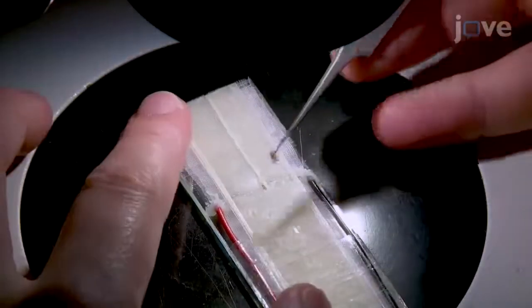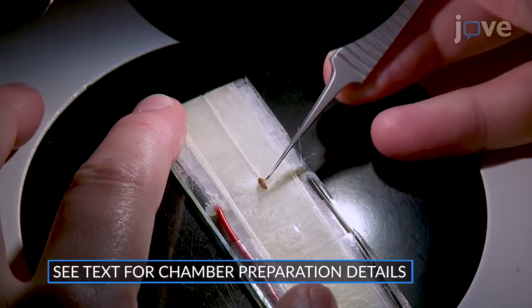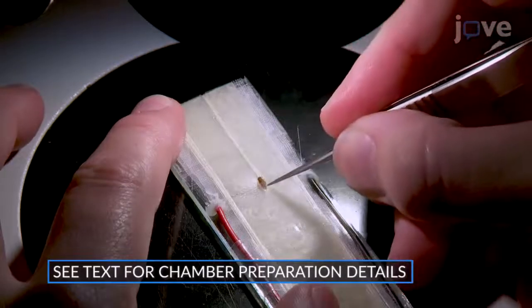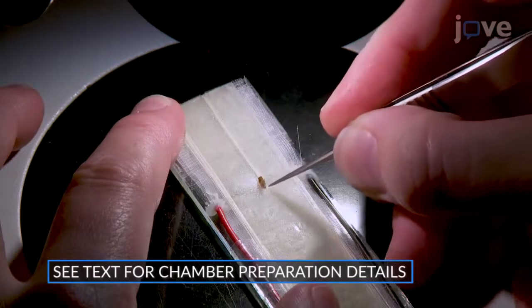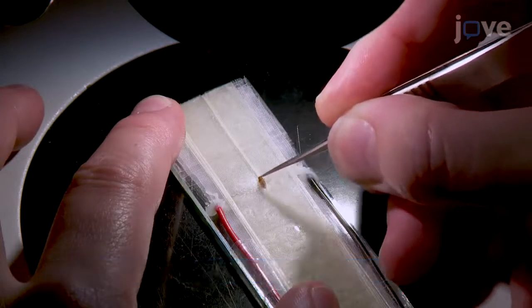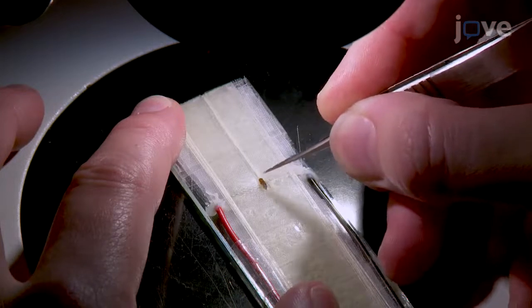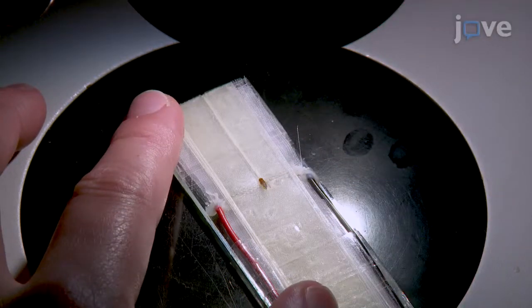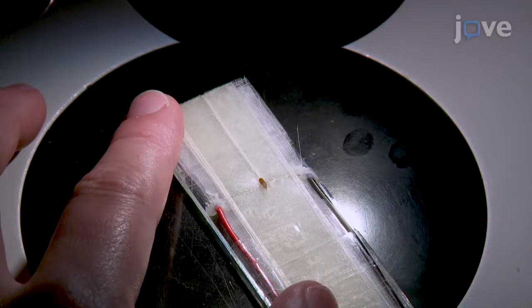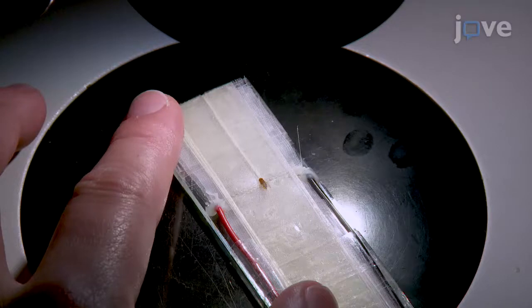To prepare a fly for imaging, use fine forceps to place an ice-anesthetized fly into a custom-prepared imaging chamber, using a dissecting microscope to position the thorax and legs in contact with the electrical wires at the bottom of the chamber and with the head lying flat.